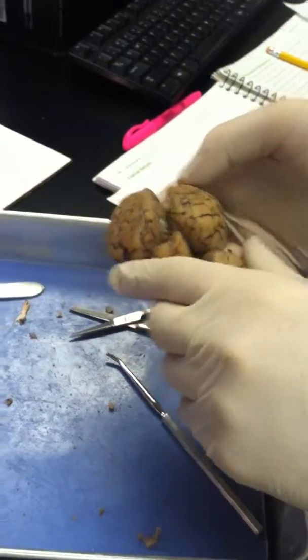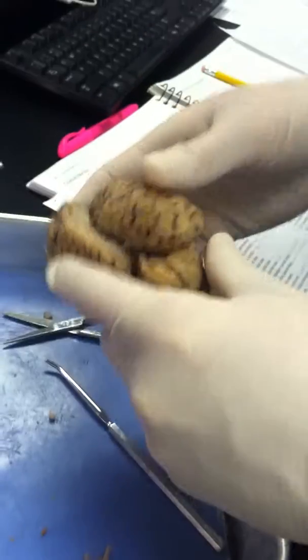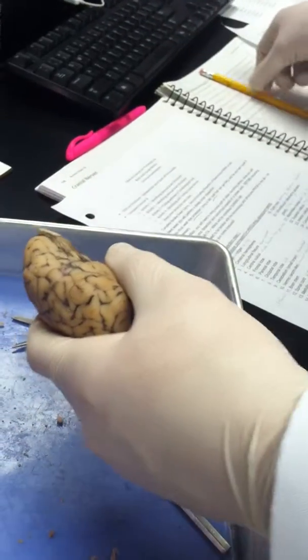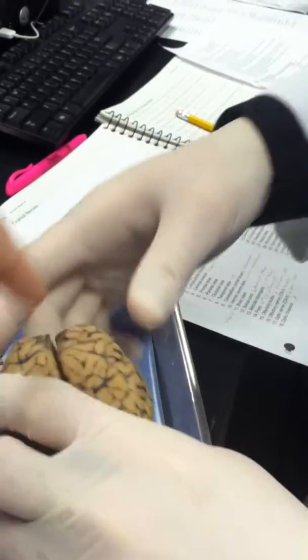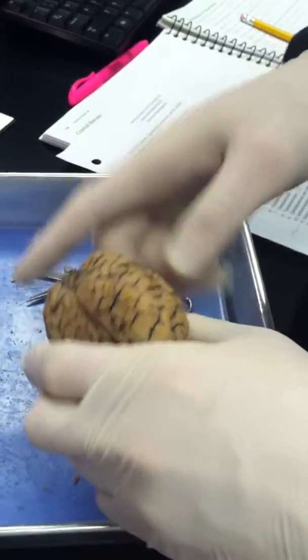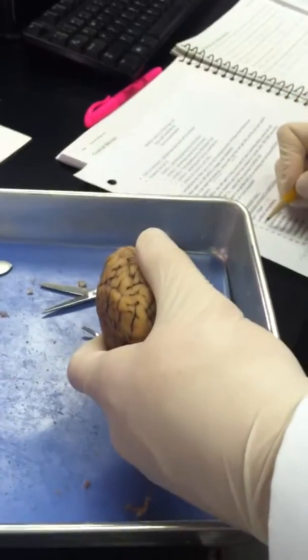You want to stop it? I think, did I do that right? Okay. Gosh, I missed the central sulcus. What is that again? Central sulcus. That's right here? Yeah. Okay. It's just still going, the video. Is it still going? Yeah. Okay.